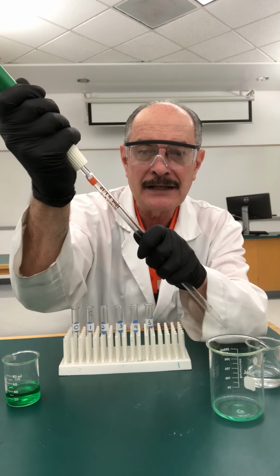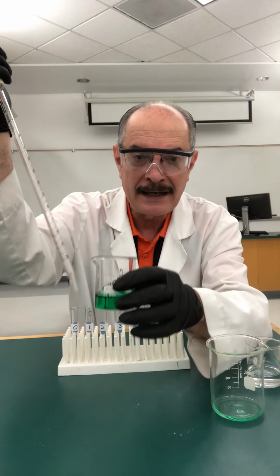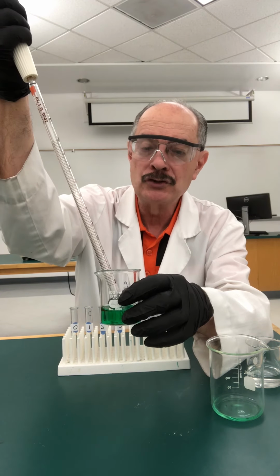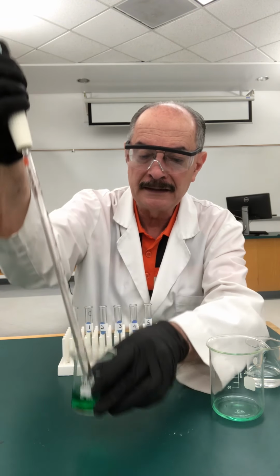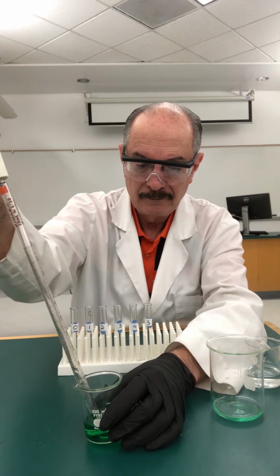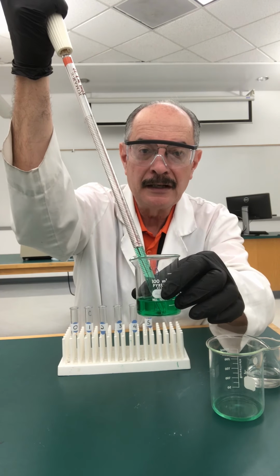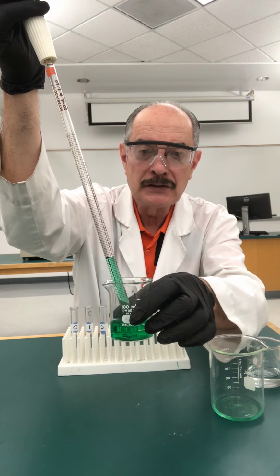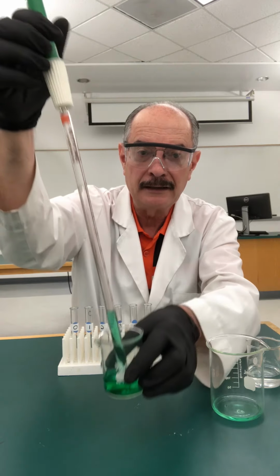So the first thing we're going to do is condition the pipette. I'm going to attach this very carefully, and this was why I had my solution in a beaker, so I can dip into it. And now I'm going to draw up a certain amount of the liquid in there. You can see it going up the pipette there. See it there going up? It's a little slow. There's a little drag between when I pull the little wheel here and the liquid goes up.